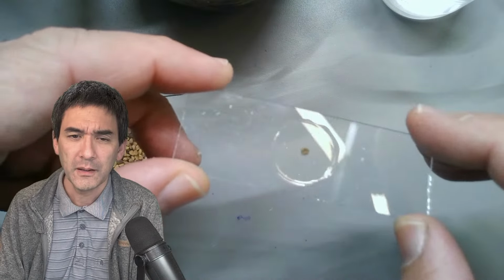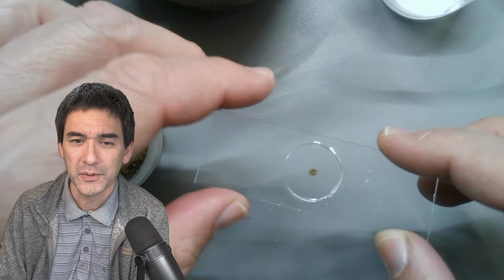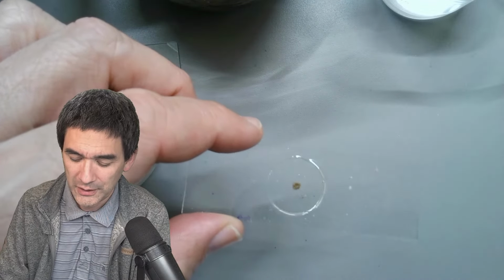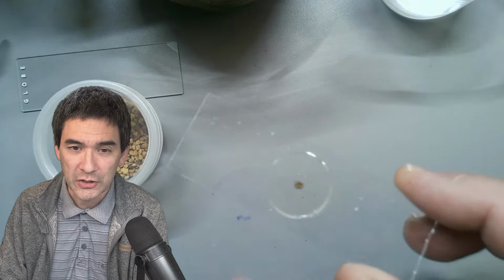Number two, something I wanted to show you, was it two or three weeks ago, I made this slide over here. If you remember the little carpet beetle, it molted, and I put some of the exoskeleton, basically the shed outer part, on a slide. When it's molting, it's shedding its skin, and we made a mount here, and it's actually looking pretty good. It's a very nice mount, and I would like to show it to you because the mounting medium that they used, Euparal, is actually quite good for these things.